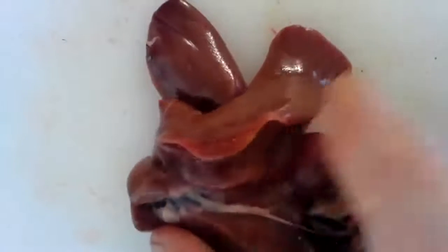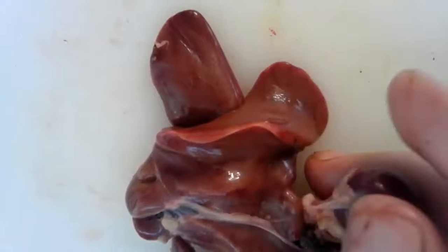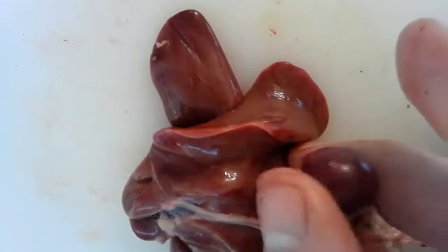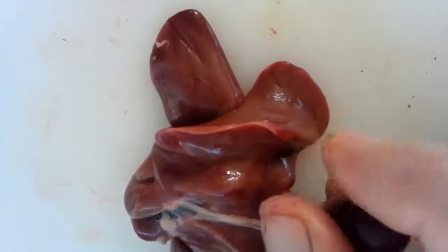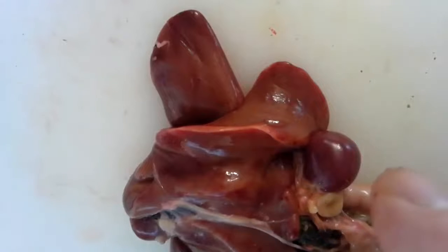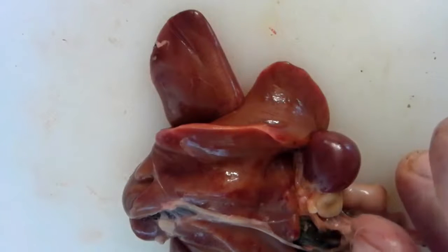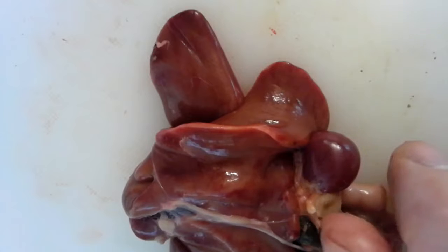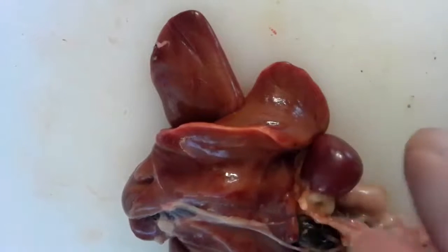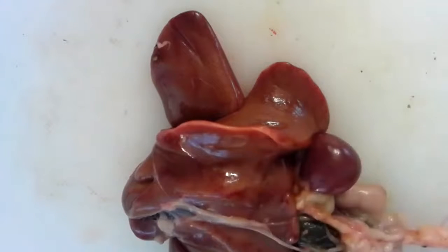So, another interesting organ down here. Look at this little guy, this little bulb here. This is the spleen. The spleen is a neat little organ. It's like a little bag full of blood, and it helps your blood mix with other bits of your blood, and it helps to transfer immunity, like the antibodies you build after you have a cold or the flu. Well, this helps to mix it so that all of your blood ends up getting those antibodies, not just some of it. So, pretty interesting little organ.